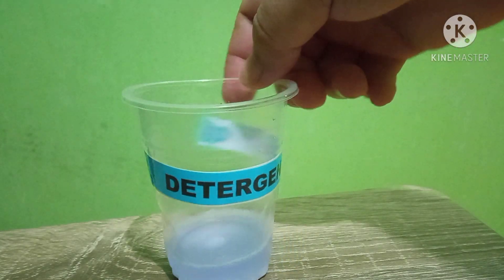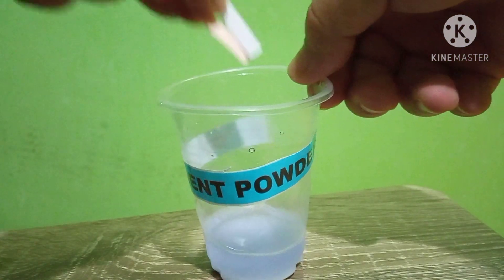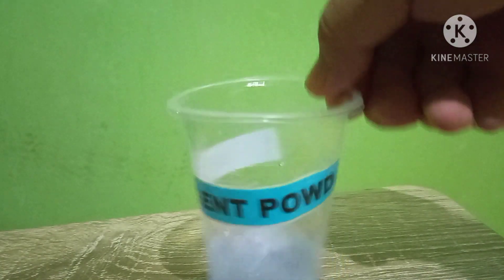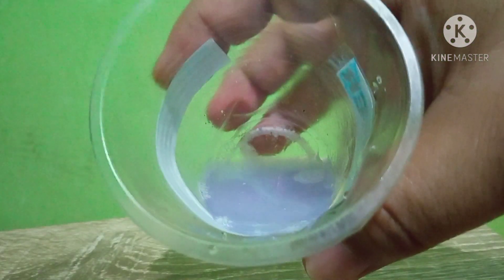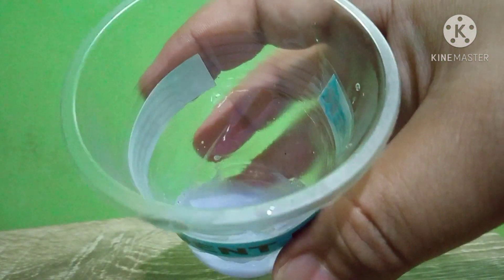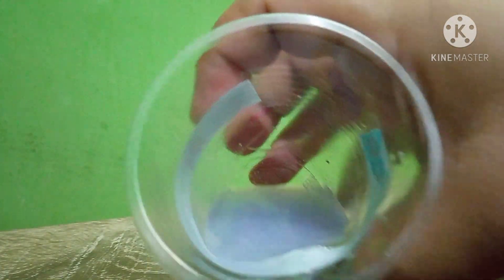Number seven is Detergent Powder. Let's check the detergent powder. Both changed color — they turned blue. So detergent powder is basic.